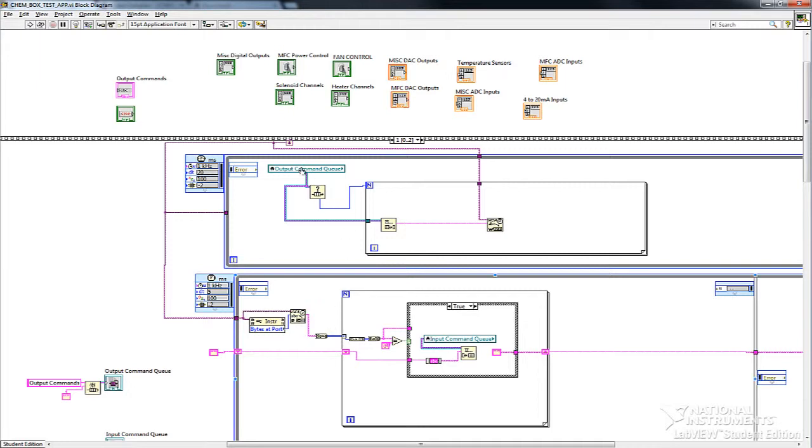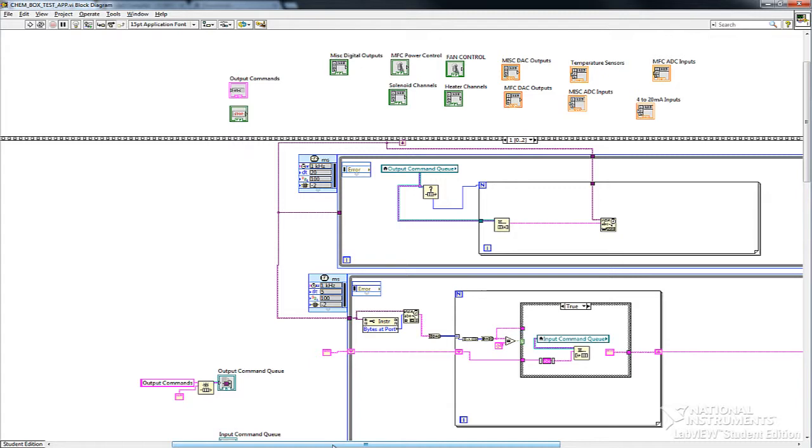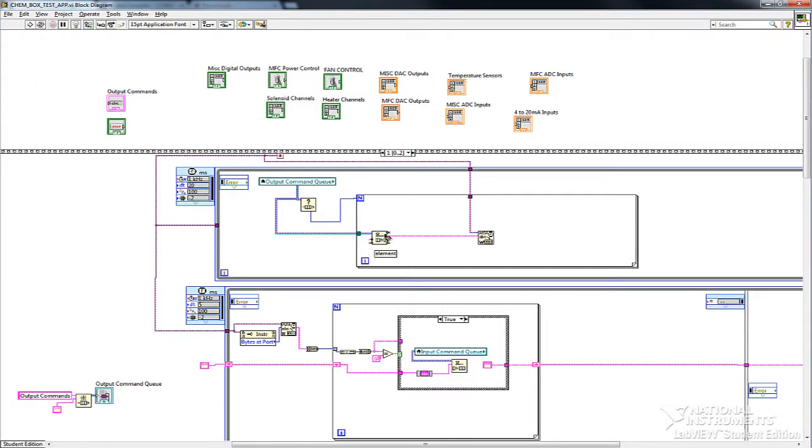So in LabVIEW, I have two queues, one called output command queue and one called input command queue. All they are is a new queue that's a queue of strings. And I have two while loops, and the only thing they do is look at these queues, in this case at a kilohertz, every millisecond, to see if another function has put something in the queue and sends it out. So if we look at the output command queue, notice how I check the queue size, and if there's elements, I dequeue it and then write it to the serial port with this VISA serial write command. So with your LabVIEW, you're going to have the VISA serial drivers enabled.